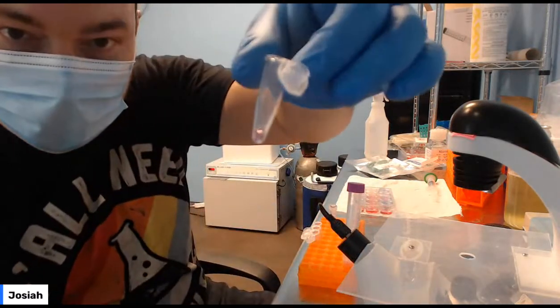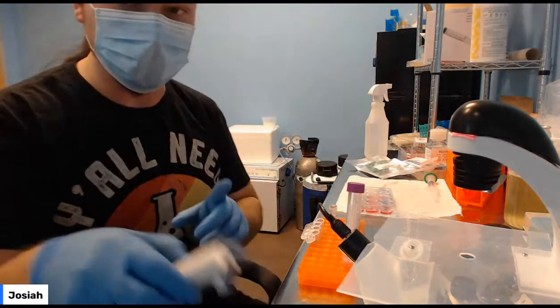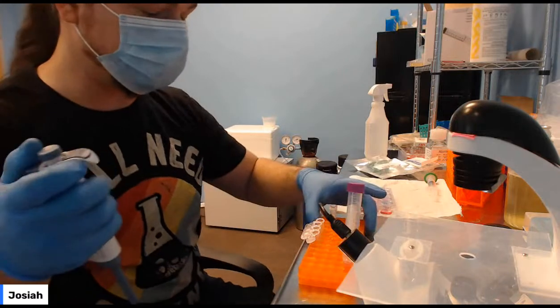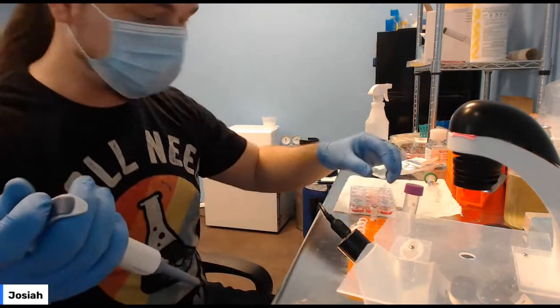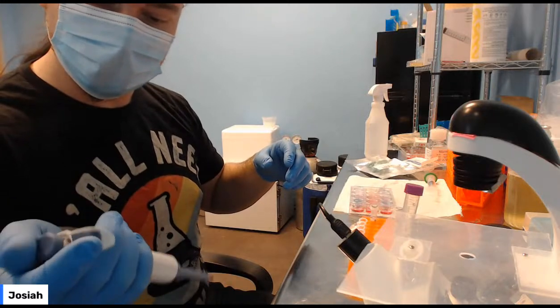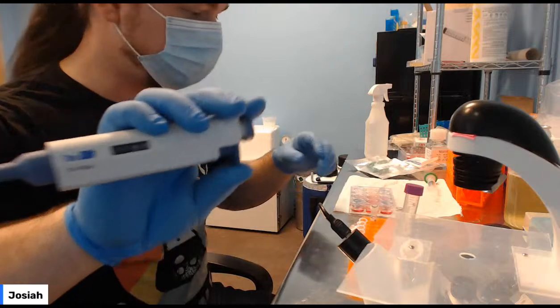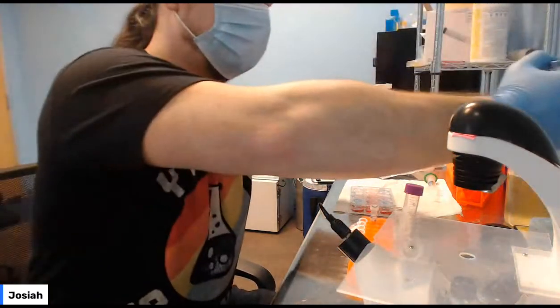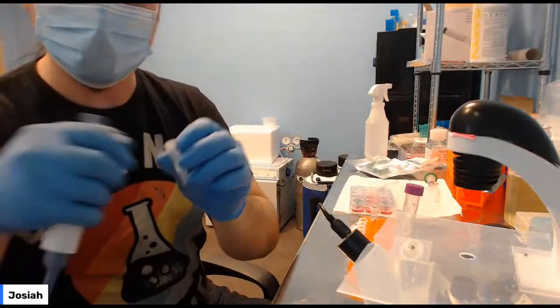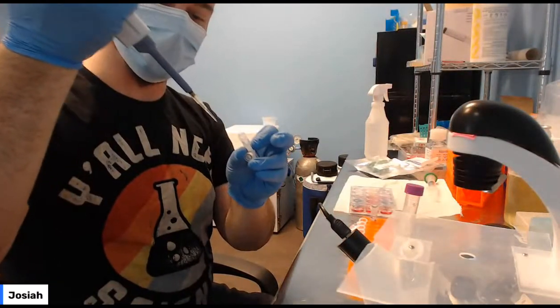And so you'll see it's got a little drop of media, nothing too huge. Then we're going to add the DNA. Actually, we need to resuspend it first. So we're going to take 55 microliters. All right, so 55. Get a new pipette tip. We're going to take our sterile water and pick up 55 microliters of water.